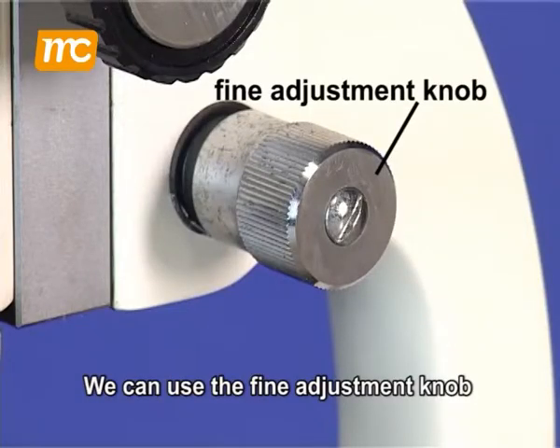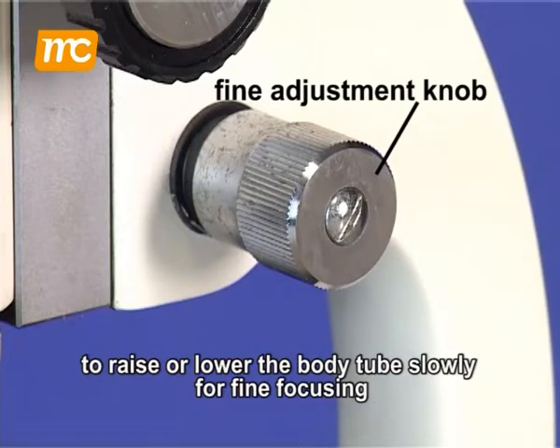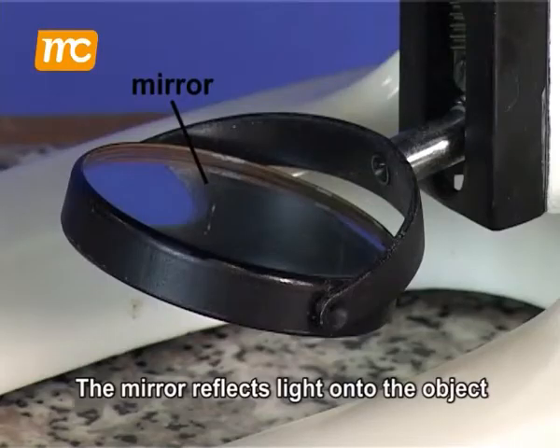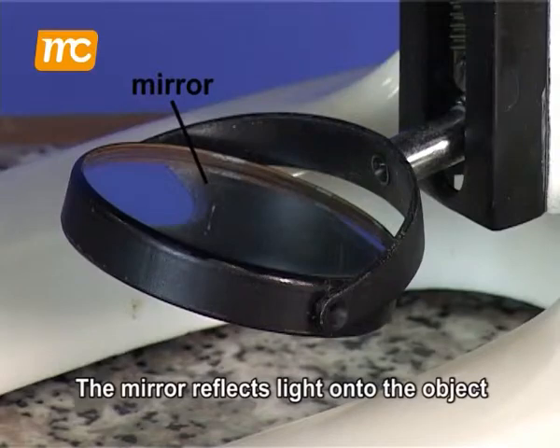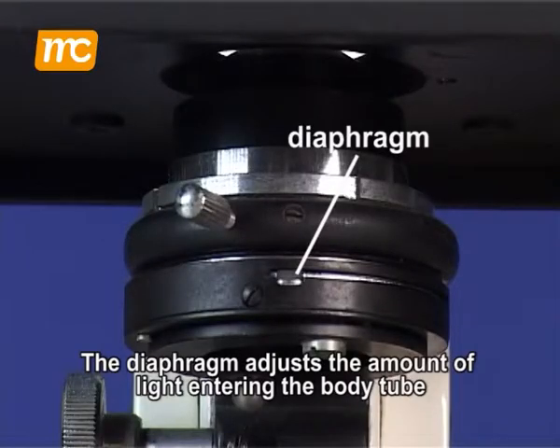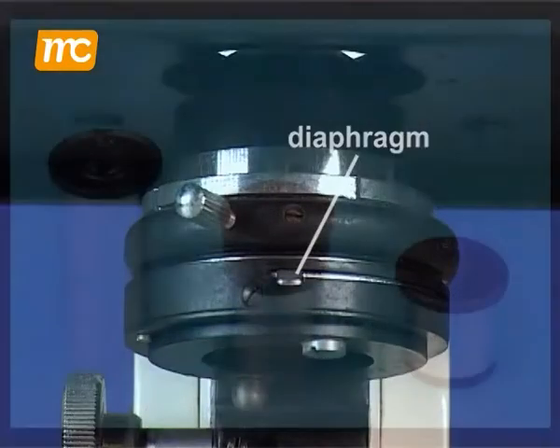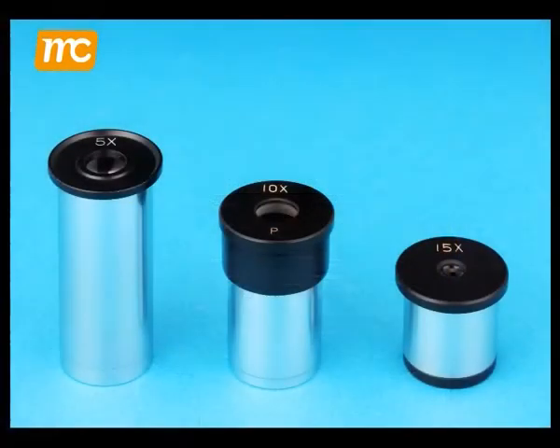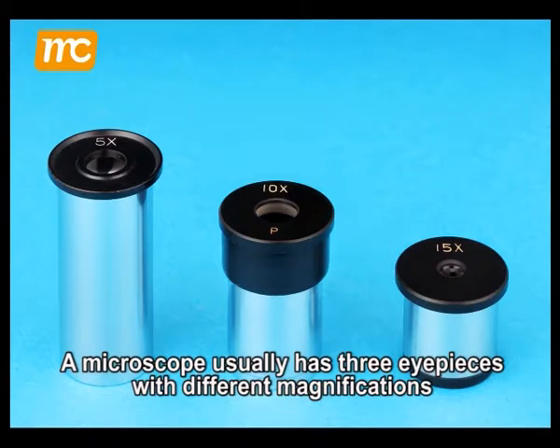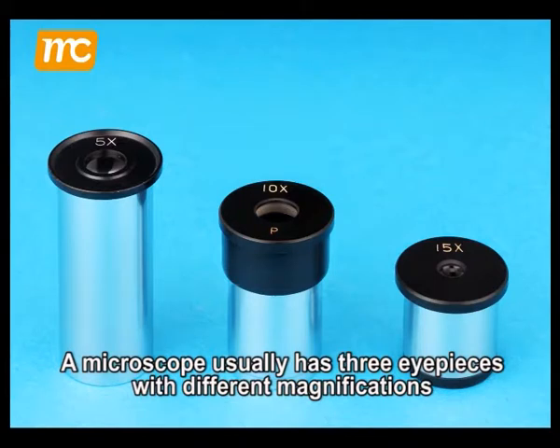We can use the fine adjustment knob to raise or lower the body tube slowly for fine focusing. The mirror reflects light onto the object. The diaphragm adjusts the amount of light entering the body tube.